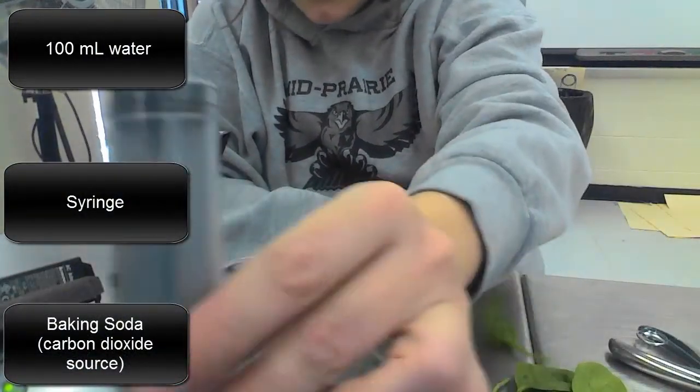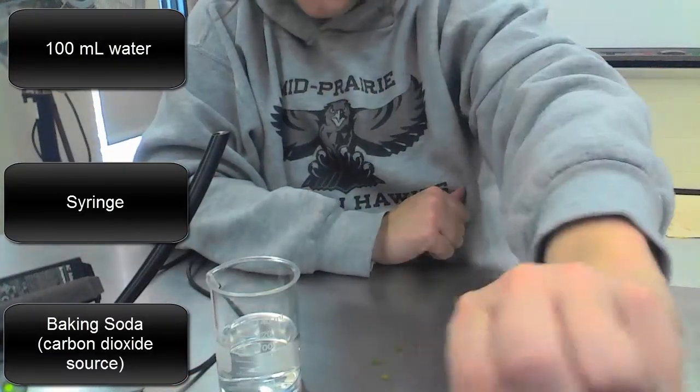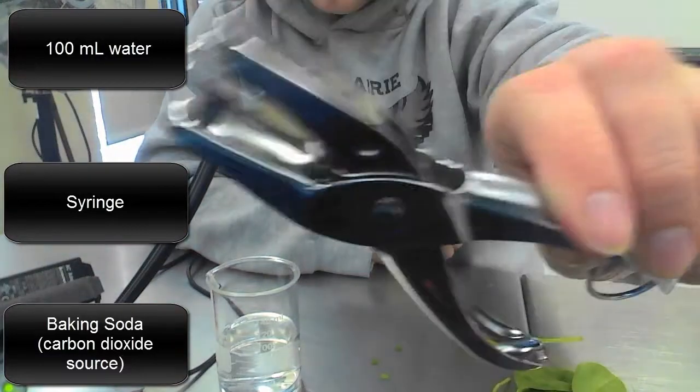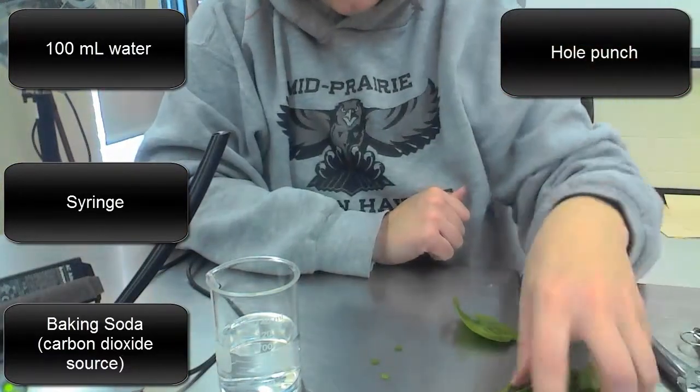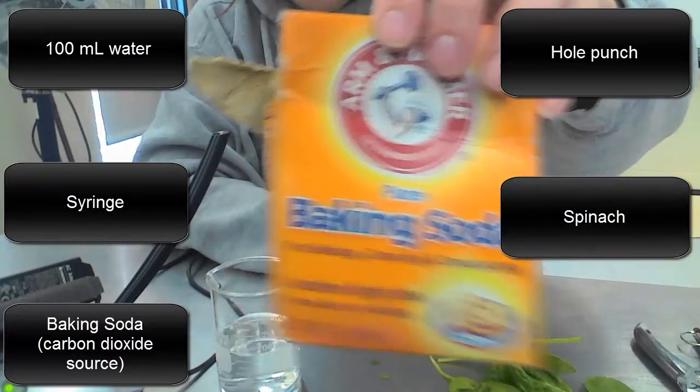So you can kind of see the syringe there. No needle in the syringe. You'll need to have a hole punch. Let's see if I can grab that. So, a hole punch. You'll need to have some spinach leaves, and then you'll need to have some baking soda.